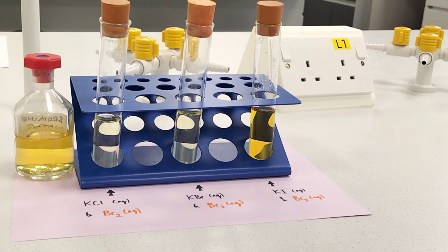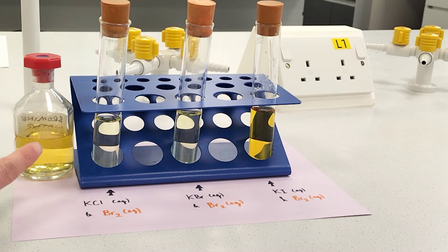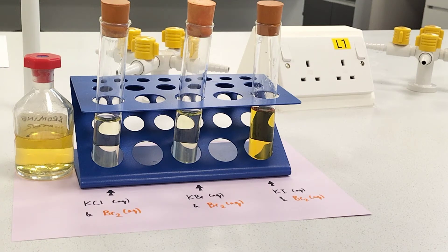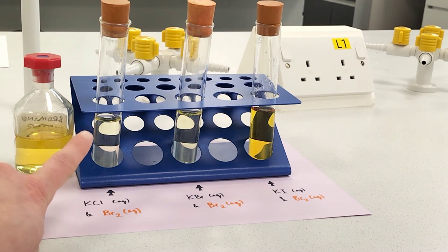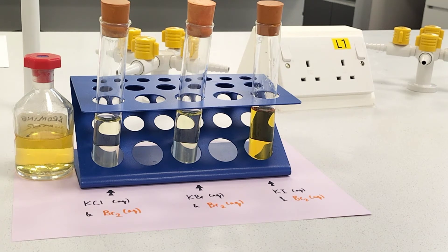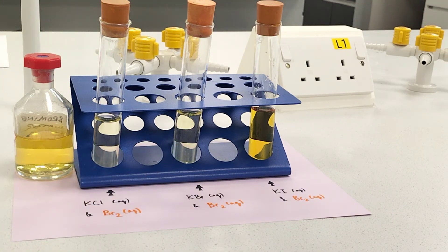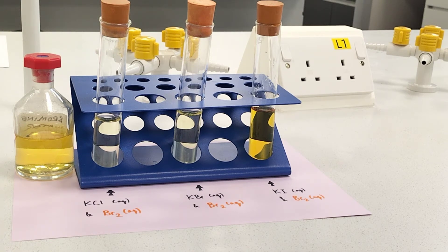Here are the results after the addition of the aqueous dilute bromine. The bromine water bottle shows it is a light yellow colour — more orange if concentrated, more yellow if dilute. Upon addition to potassium chloride, not much has happened; it just looks more dilute yellow — no displacement reaction, as chlorine is more reactive than bromine. Upon addition to potassium bromide, not much has happened either, because bromine is as reactive as itself — no displacement reaction.